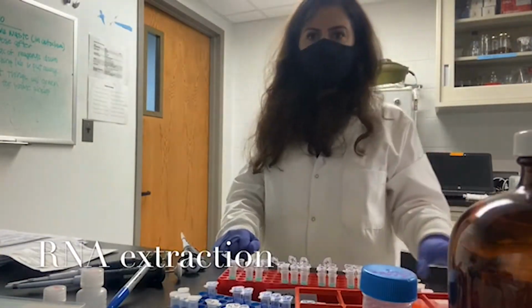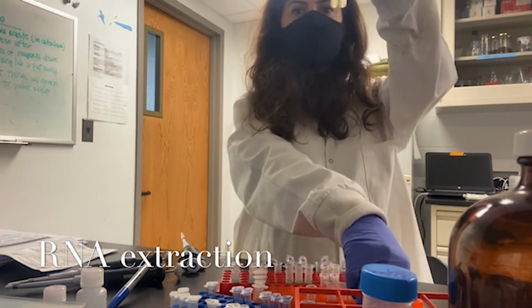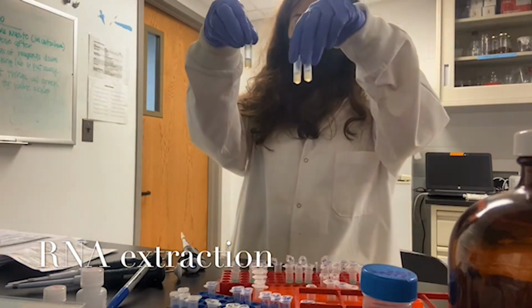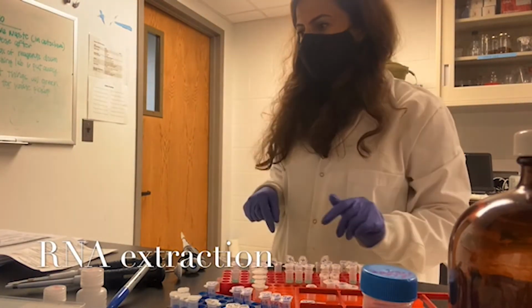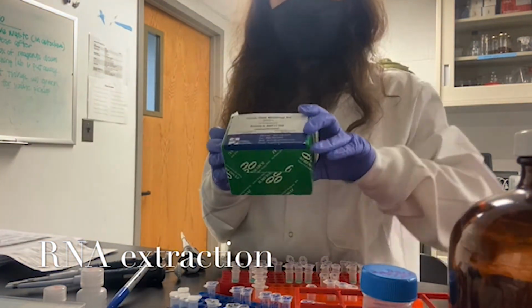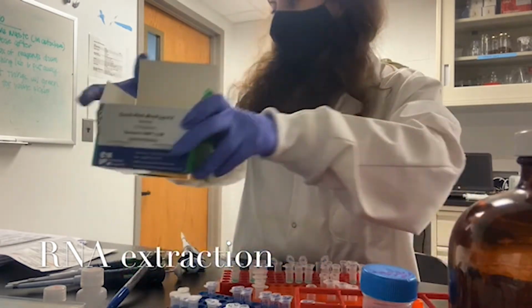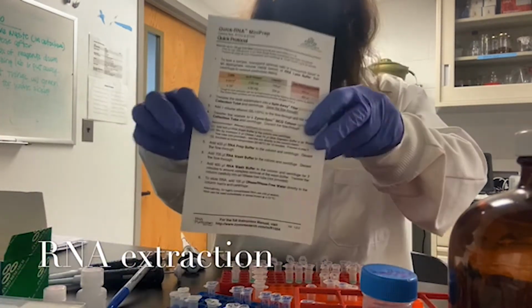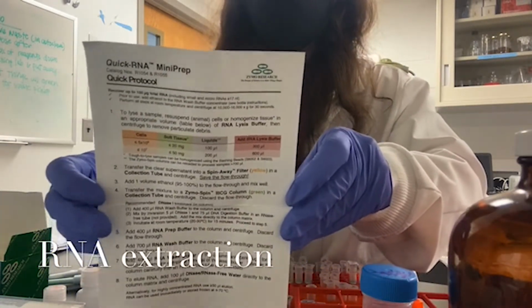So hi everyone, now we concentrated our samples to 1 milliliter, and now I'm going to do RNA extraction. I'm going to use the Quick-RNA MiniPrep kit, and it comes with a quick protocol, and I'm going to basically follow this protocol.